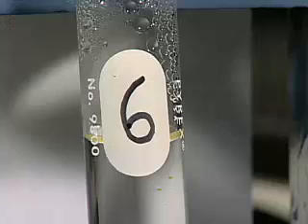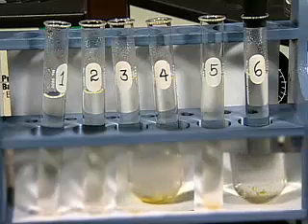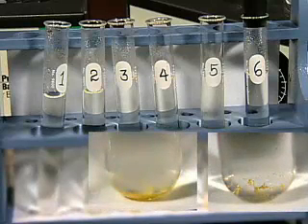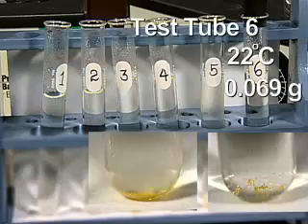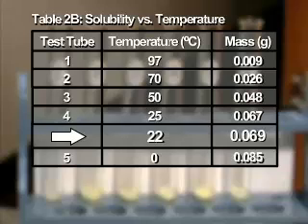Now let us revisit the solution that was not placed in a water bath and as a result cooled slowly to room temperature. Do the crystals form differently when the solution is cooled slowly as compared to when it is cooled rapidly? Did the slower cooling process affect solubility? What have you learned about the solubility of lead-2 iodide and temperature?